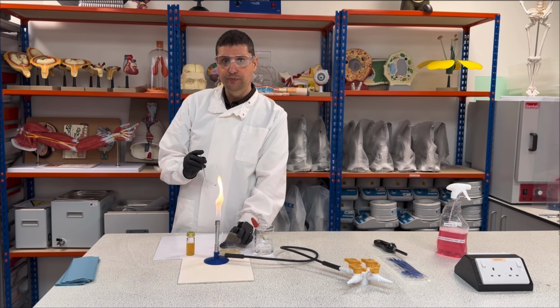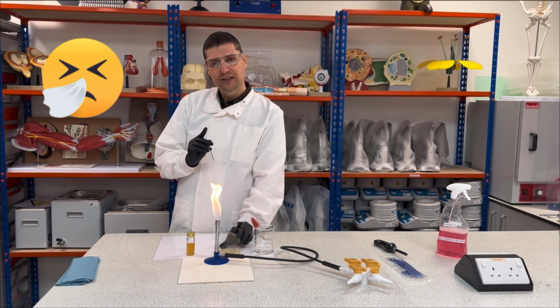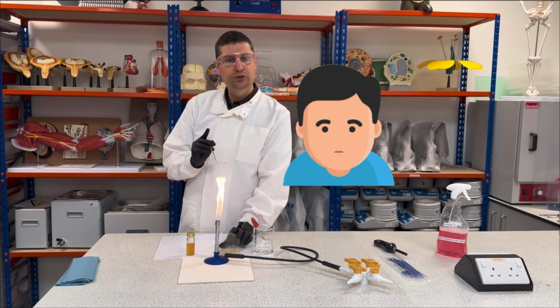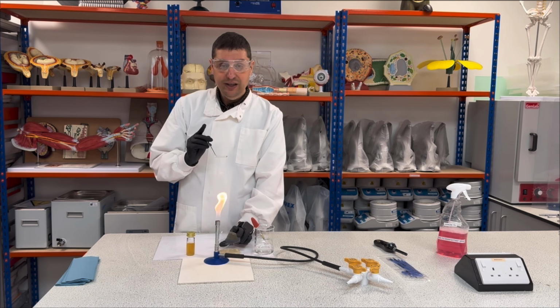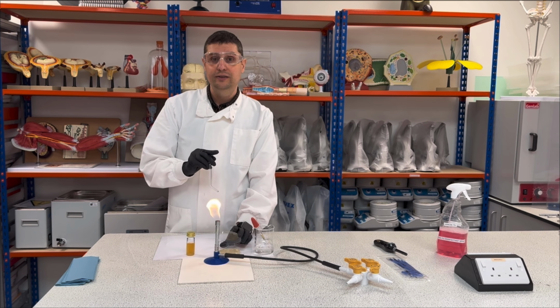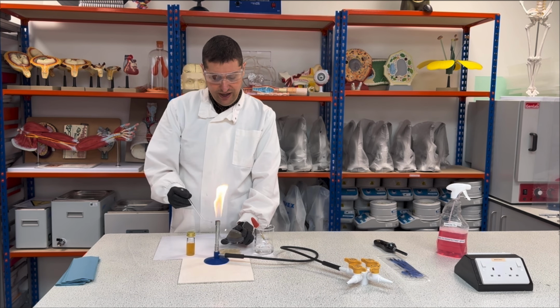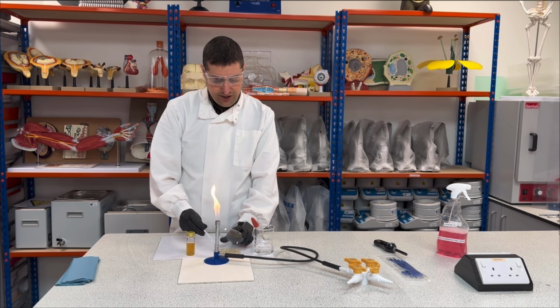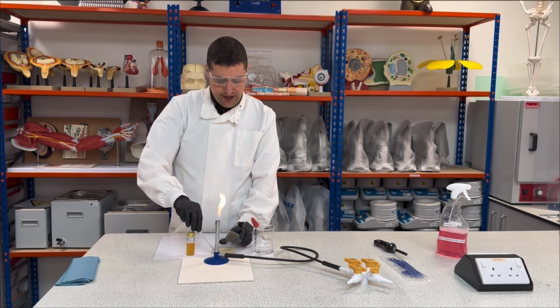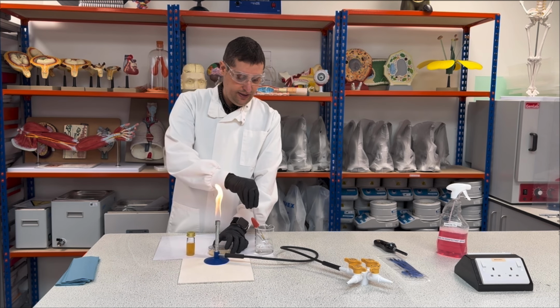Why facing you? Because you might cough, you might sneeze, someone can talk, and pathogenic bacteria can go there and will grow pathogenic bacteria rather than the bacteria I want. So this is like a shield. So the correct way is I'm gonna use here and spread everywhere. Okay? Then I close and put here.